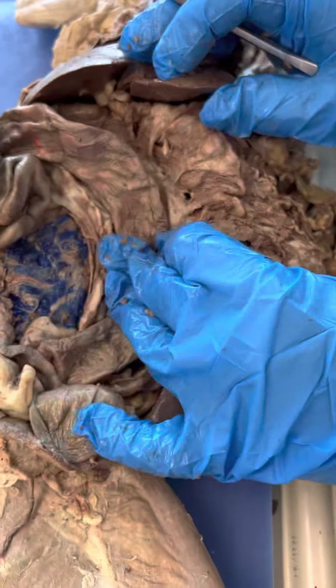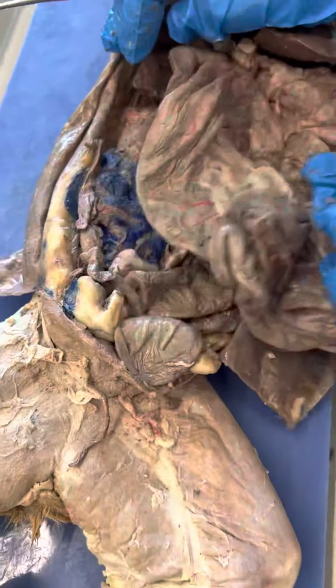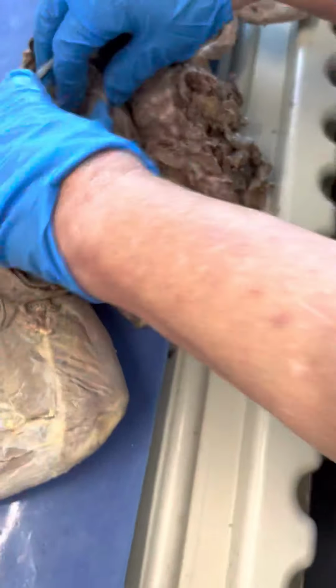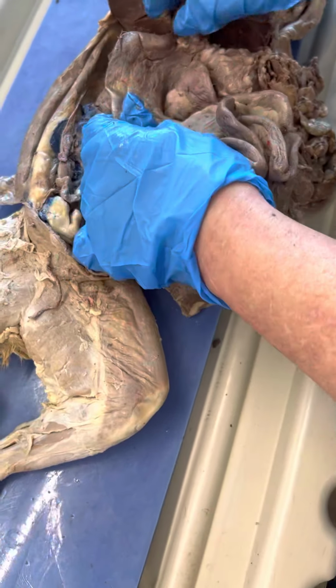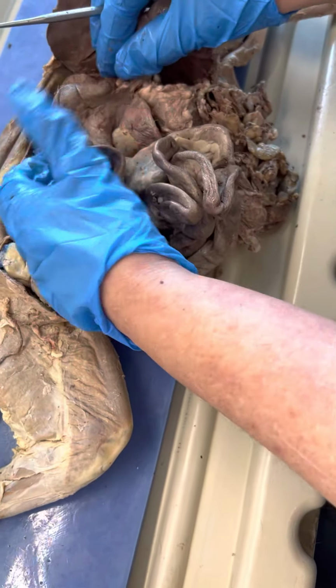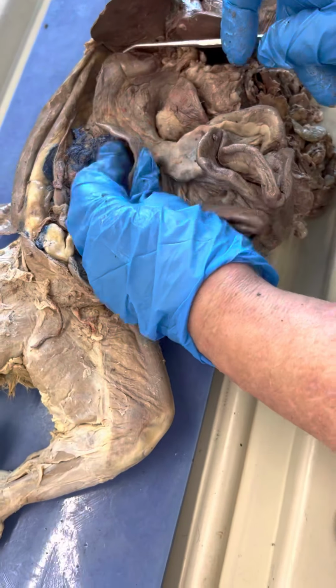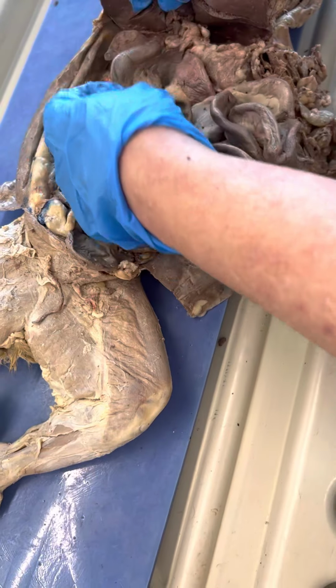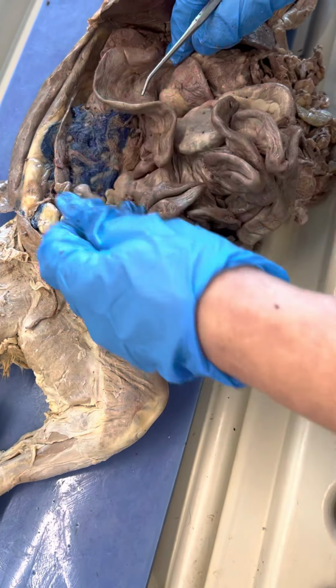Small intestine. Freshman took a nursing course. You have to handle the small intestine a little bit. And I know they don't let you touch it. The duodenum is the first part of the small intestine. It's considered duodenum until it starts to make the bends. So this part here would be the duodenum. It's connected to the stomach. Make you want to be a nurse.